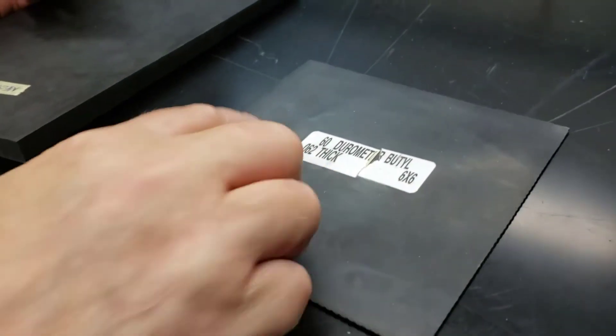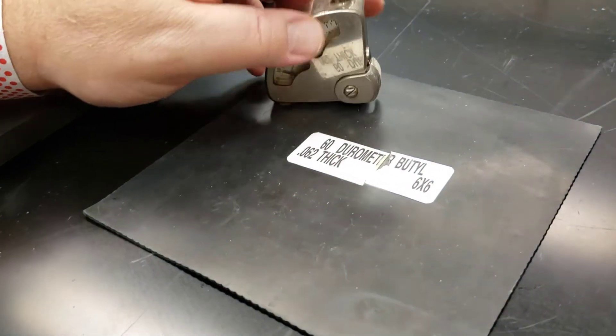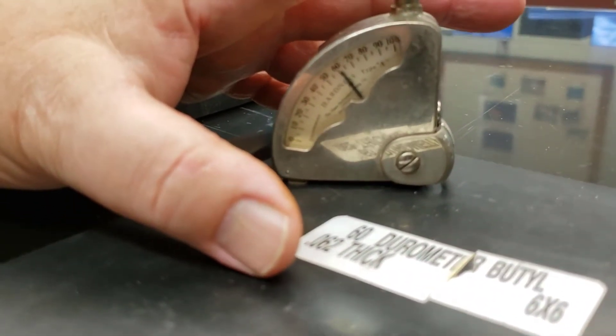This piece of butyl claims to be about 60 and we can see that's about where it is.